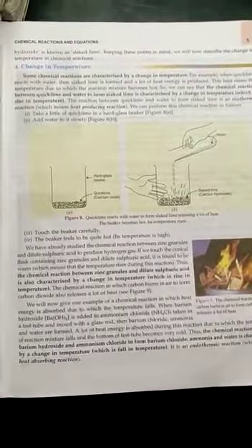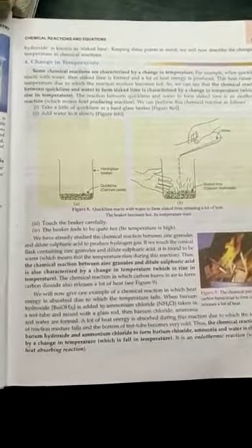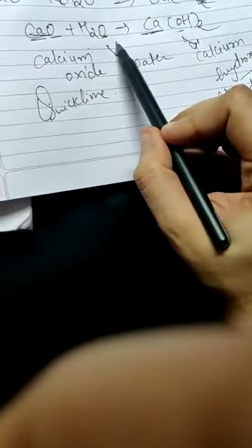Further moving, what you have to do is take quicklime, which is calcium oxide CaO. I will show you, it's written over here: CaO plus water. Add water into it. What you will get is calcium hydroxide.